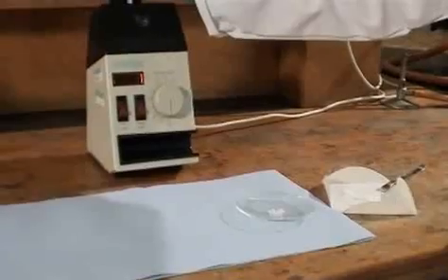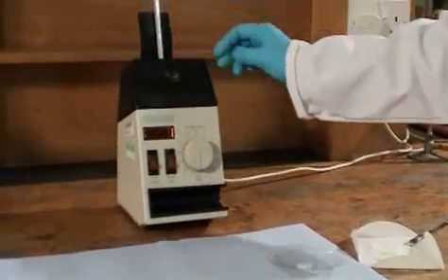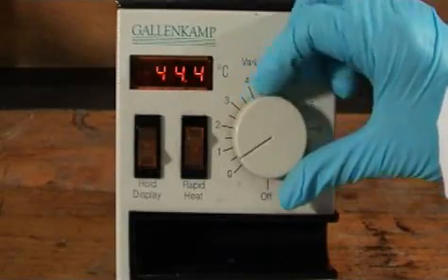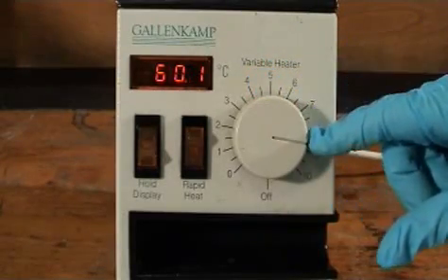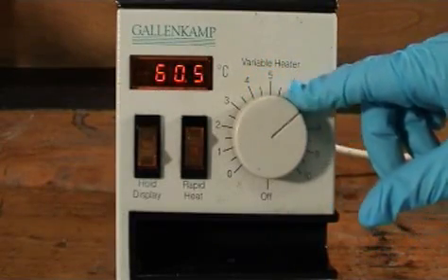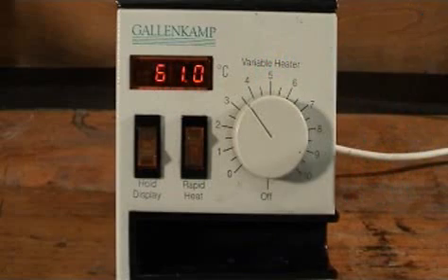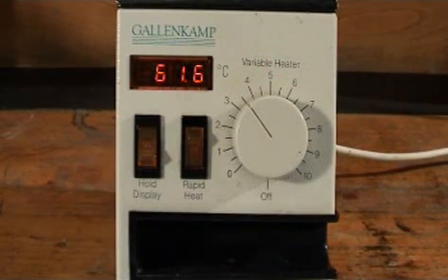Put it into the melting point apparatus and turn the heater to 3 or 4. Don't be tempted to turn it to 9 or 10 as you'll overshoot the melting point and get an inaccurate value. Don't be tempted to use rapid heat either for the same reason.